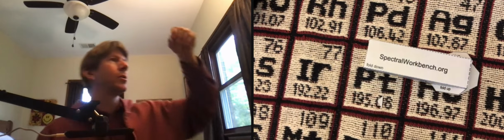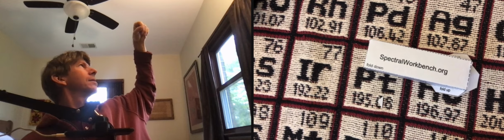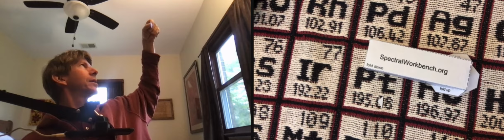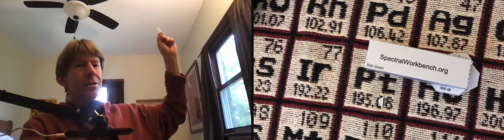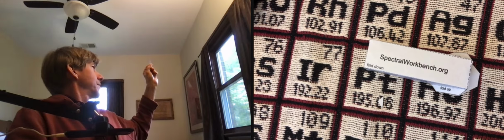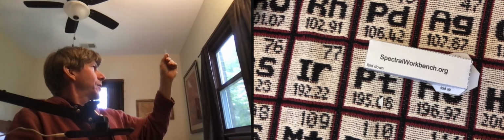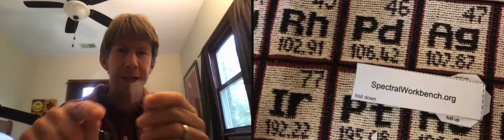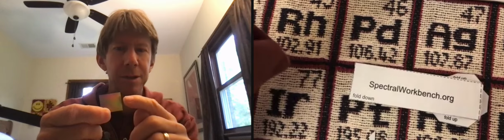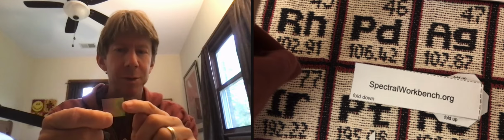And when you hold it up to the light, actually against a dark background, there's going to be a rainbow when you look at it. So I have orange on this side and blue on this side. And that means the rainbow is going back and forth here.